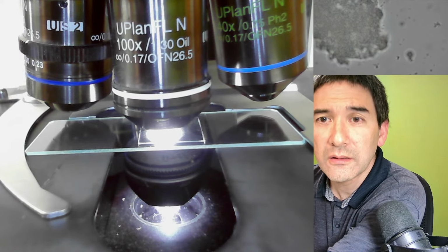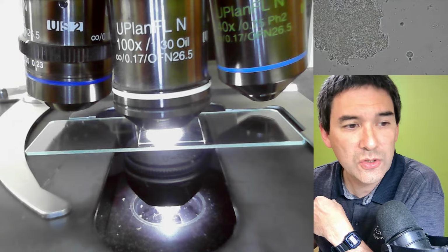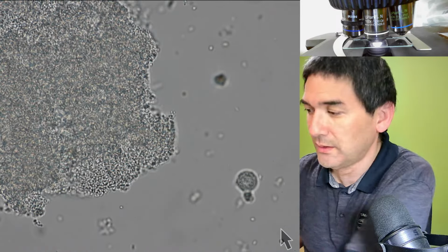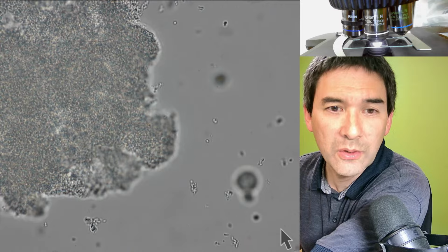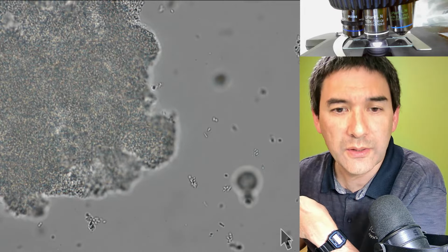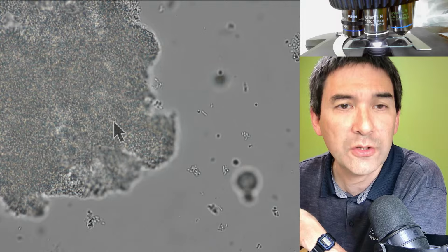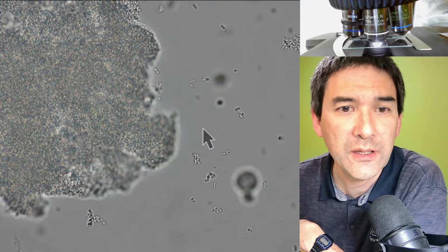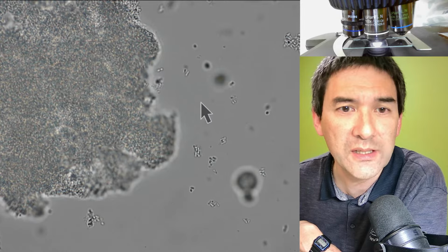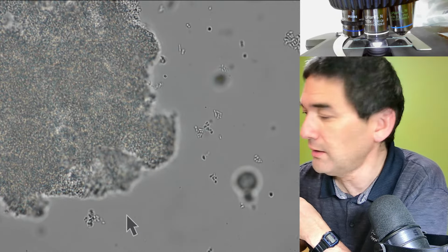Okay, and indeed, this seems to be the case here. Here we go. So these are now yogurt bacteria, and you can see over here some clusters of the freeze-dried yogurt bacteria that did not dissolve yet. But over here we can already see little cocci, or the round cells, and so on.